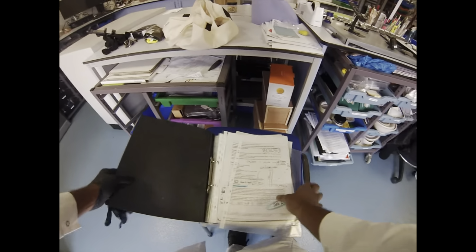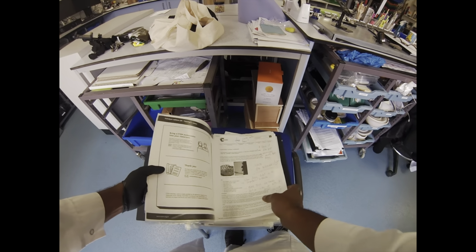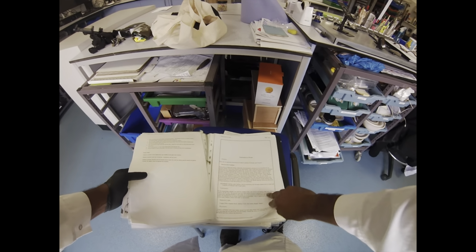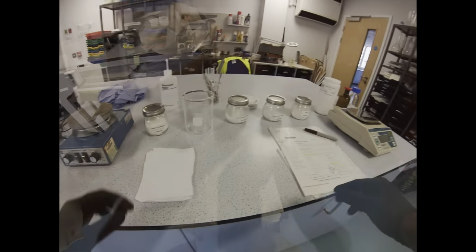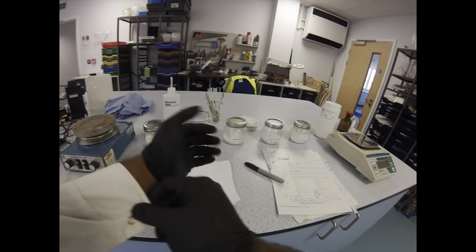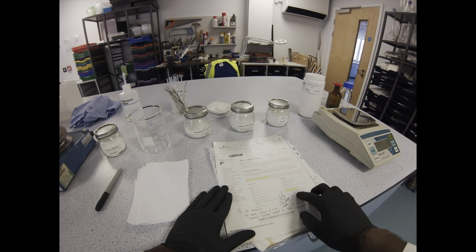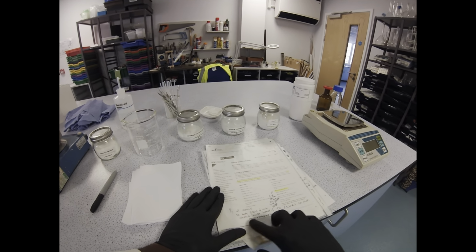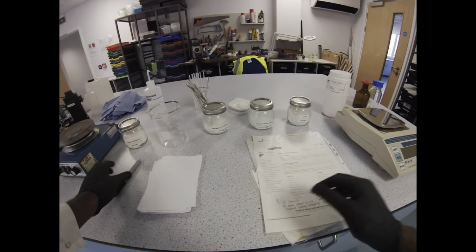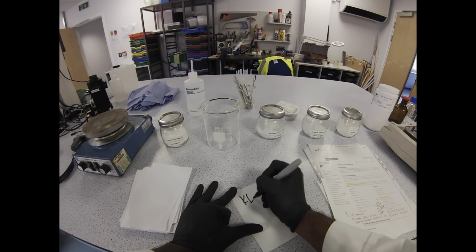Well, I like actually having lots of physical notes, so these are the notes from some of my favourite demonstrations. The recipe that I'm going to use today is actually pretty old, but I can't remember if I got this from the RSC or from a weird website called something like Science is Cool. There are definitely some methods on the Royal Society of Chemistry website, but I'm just going to show you how I make mine. I'm very tempted to update this recipe at some point, but so far I've been doing this for 10 years. It looks really good.